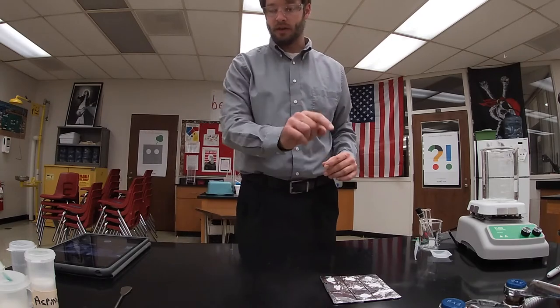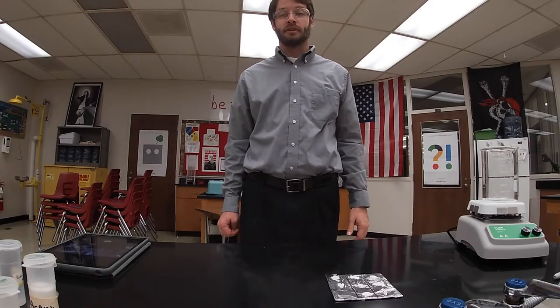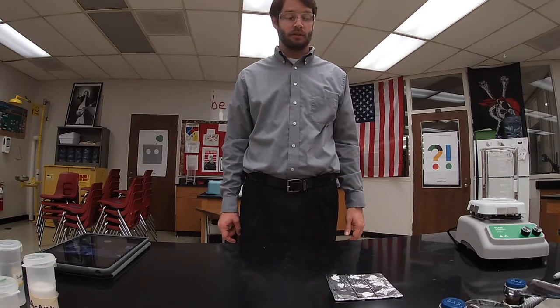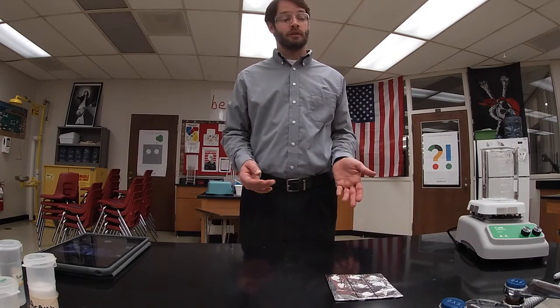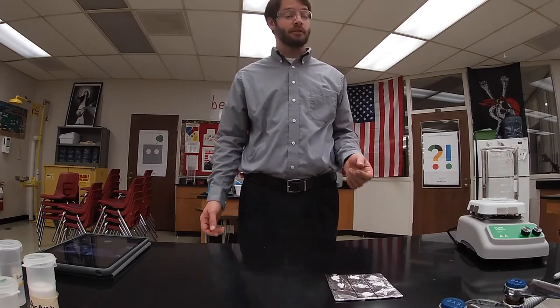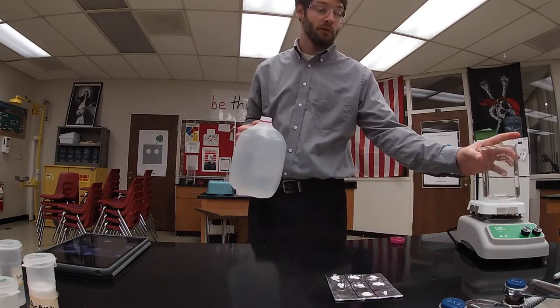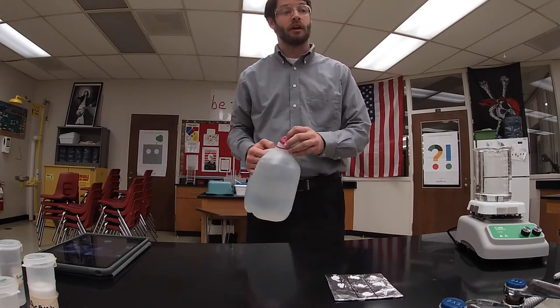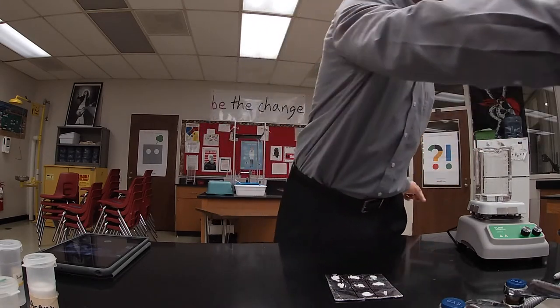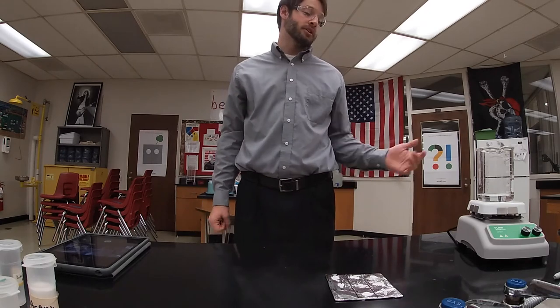So I have my nine samples. We need to record the color and texture of each sample. The next thing I'm going to do is try to establish a melting point for all of these substances. I'm going to test first if these will melt at 100 degrees Celsius. To get samples to exactly 100°C, all I have to do is take a little bit of water and boil it. Since water boils at 100°C, if the water is boiling it is at 100°C and not rising beyond that. I'm going to add a little bit of distilled water to the bottom of a beaker.